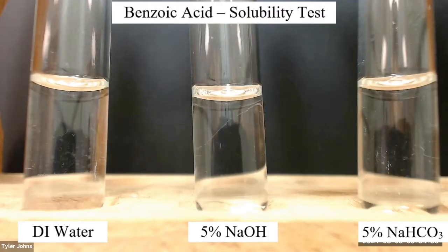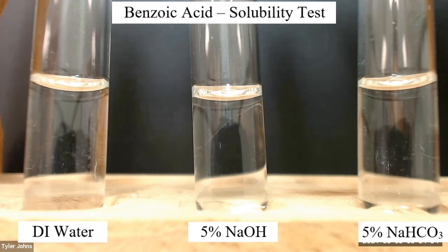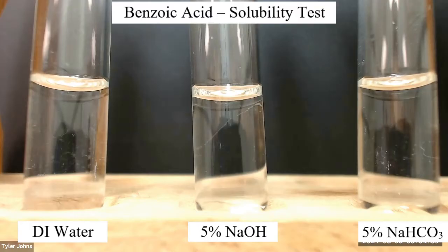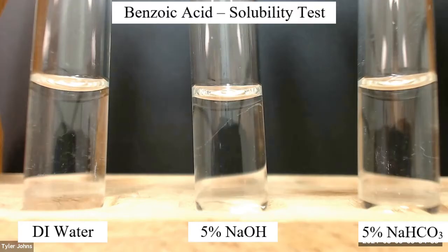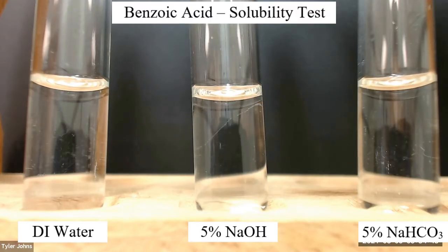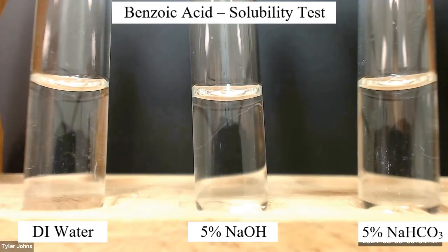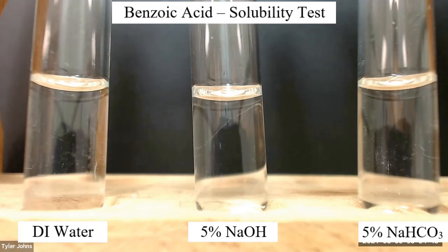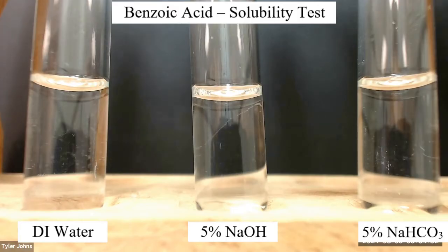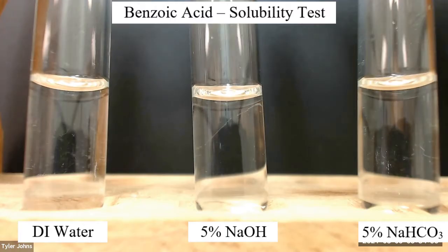We will now perform a solubility test for benzoic acid. When performing a solubility test, we will place two milliliters of the appropriate solvent in a small test tube and add one to two drops of an unknown liquid or a few crystals of an unknown solid into the solvent. We will then gently stir the contents of the test tube with a microspatula. The disappearance of the liquid or solid, or the appearance of mixing lines, indicates that solution is taking place.